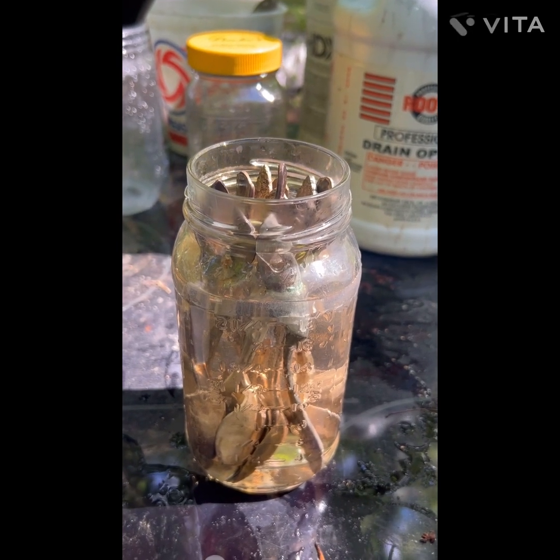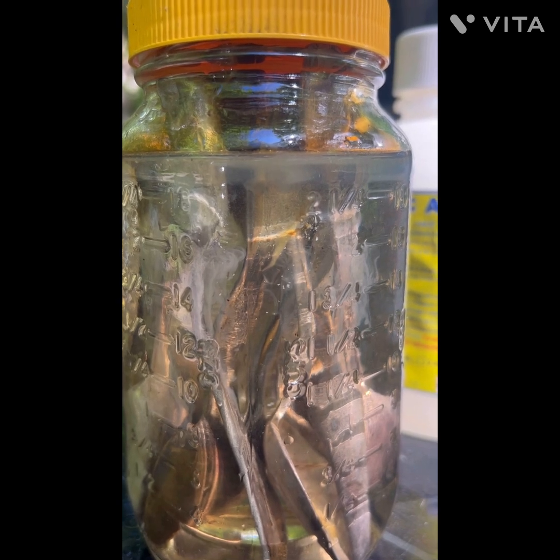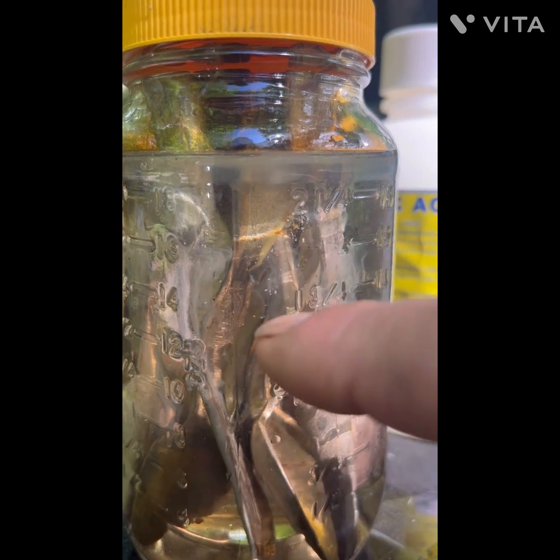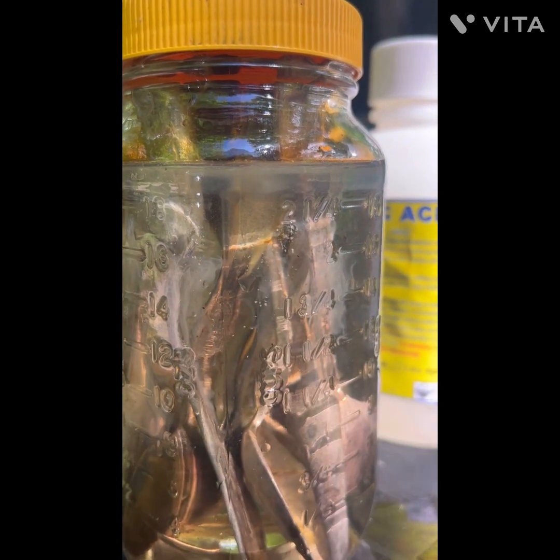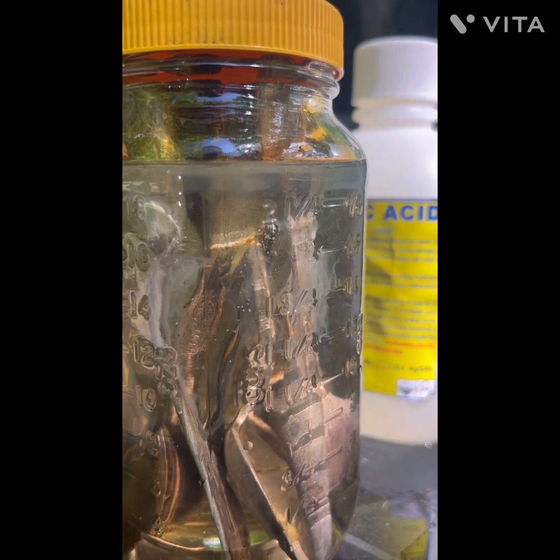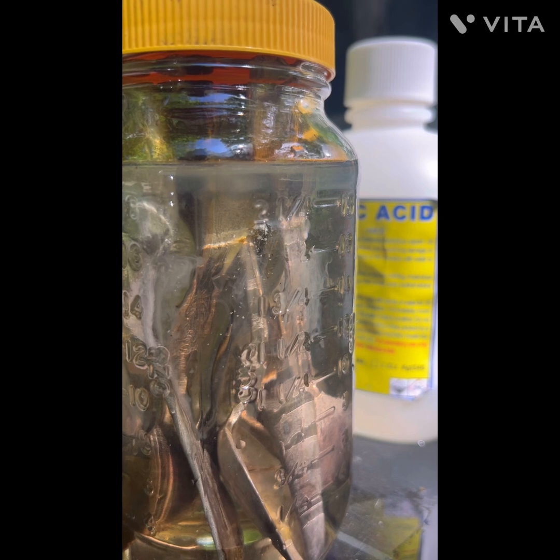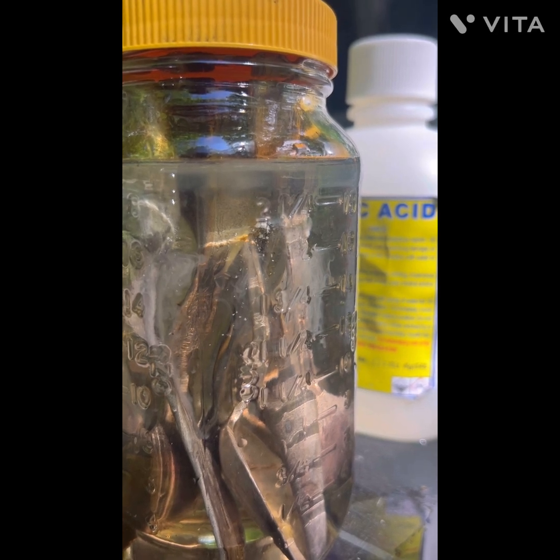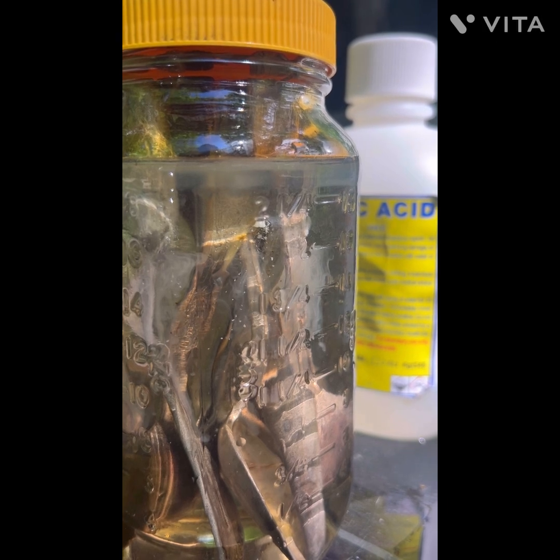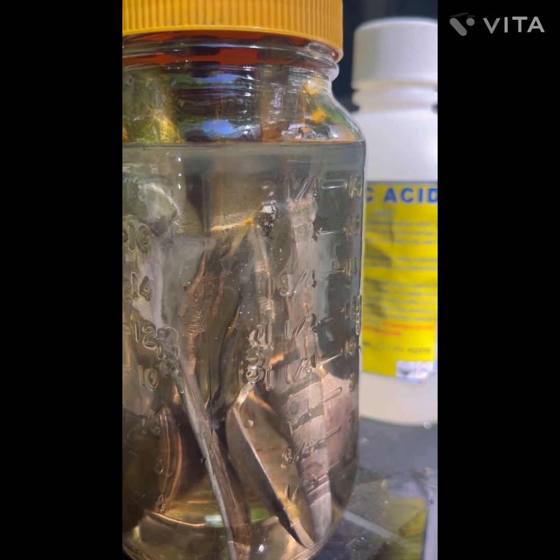It's only been a few seconds and you can see the silver is already starting to come off right here. It's just going to attack the silver and leave the base metals behind. So what we're going to do is remove the silver plating like that, and then I'll replenish it or flip it upside down — we'll handle that when we get to it.